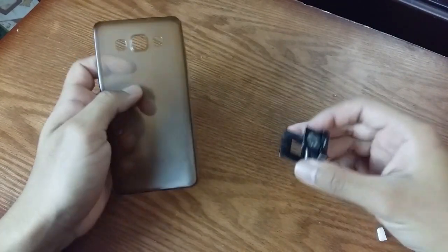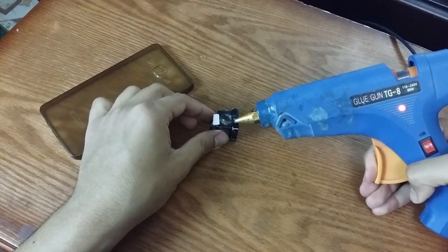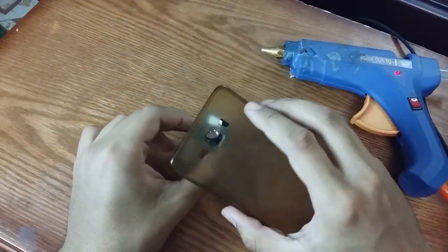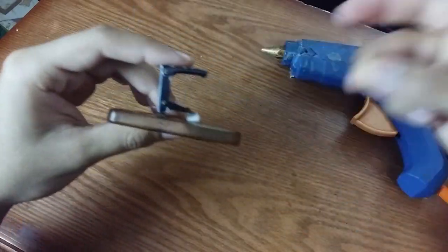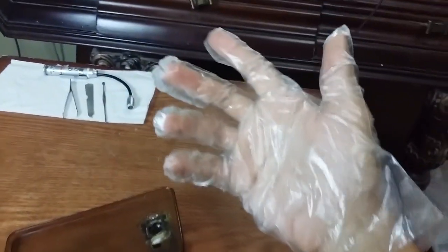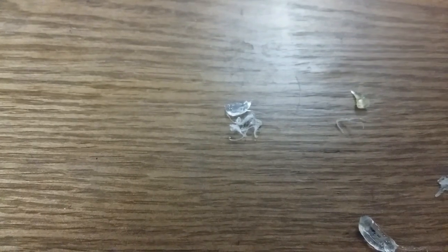This is my phone cover and I will try to clip it onto it. Now this is ready to use, I've prepared my tools and I'm wearing my disinfected gloves. Oh look, some glue remains — let's see it with the microscope.